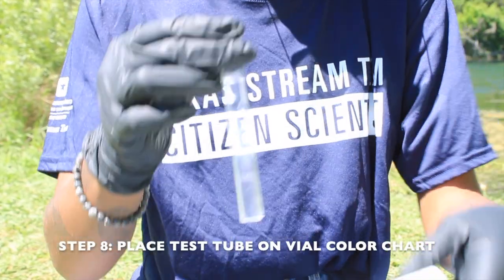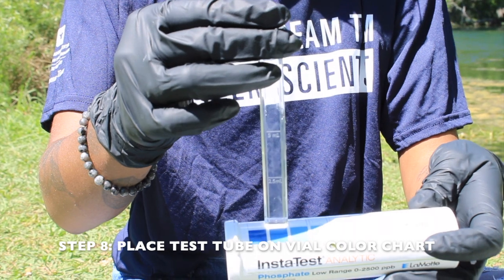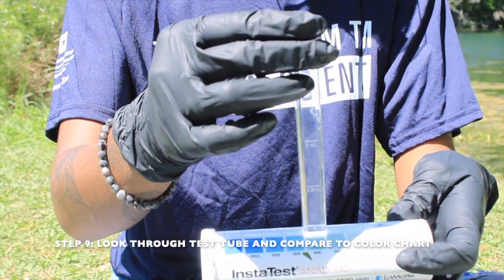For step 8, place the bottom of the test tube on the white boxed area of the color chart located on the vial with the test strips. For step 9, look down through the open test tube and compare to the color chart on the vial.